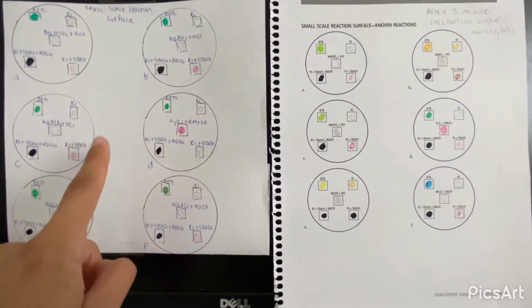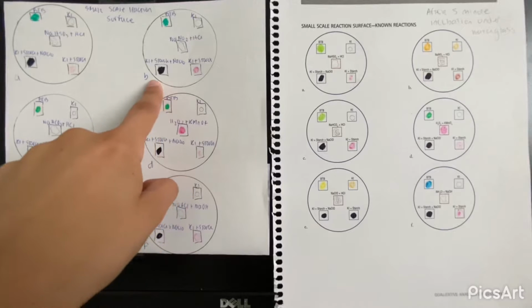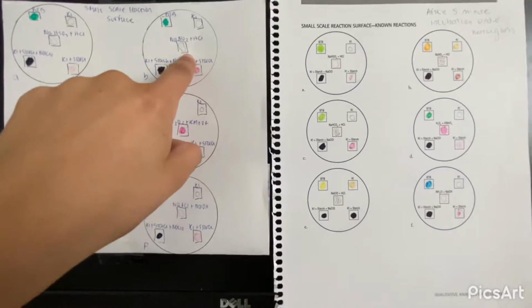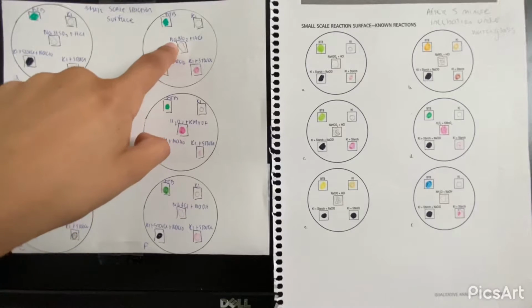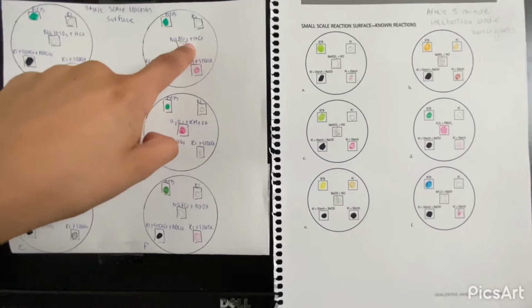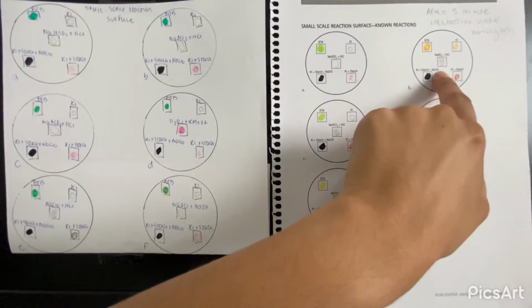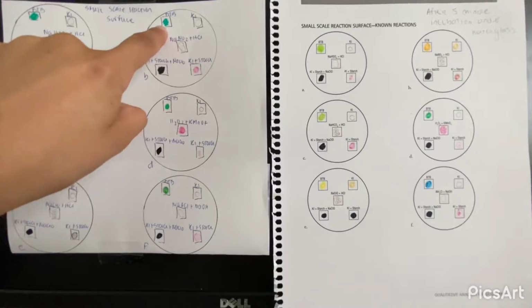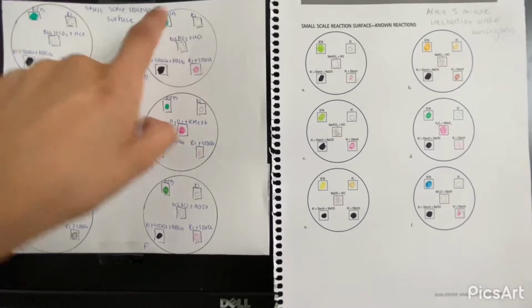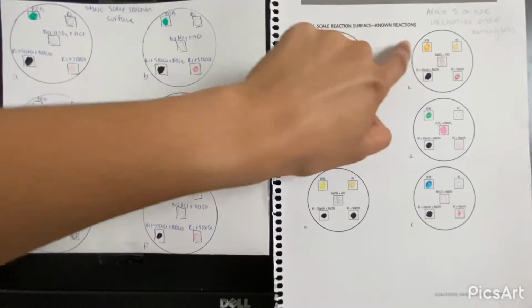Then, for example, for chemical reaction B, our chemical reaction is NaNO2 plus the HCl. After the 5 minutes, we can see presence of gases. We can see bubbles here. Our BTB starts green, dark green, and after the 5 minutes, we can see it's like a strong yellow-orange.